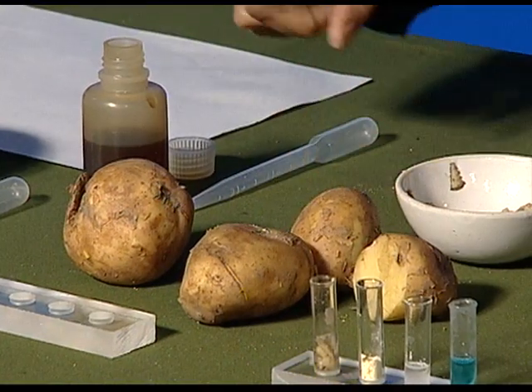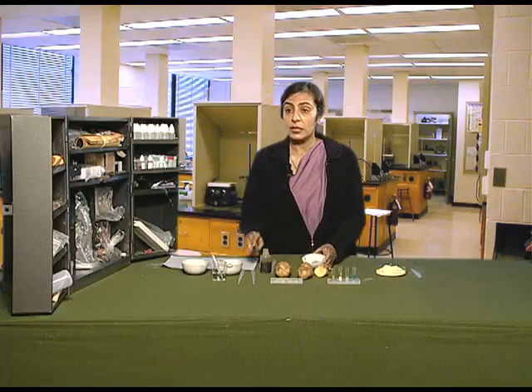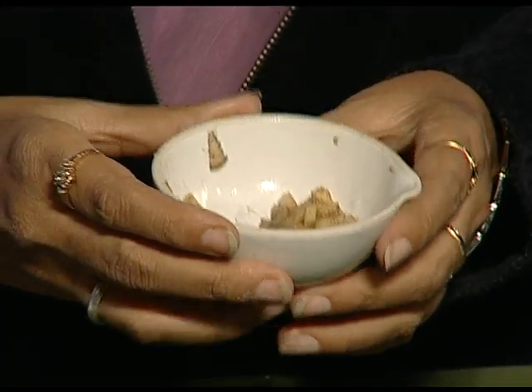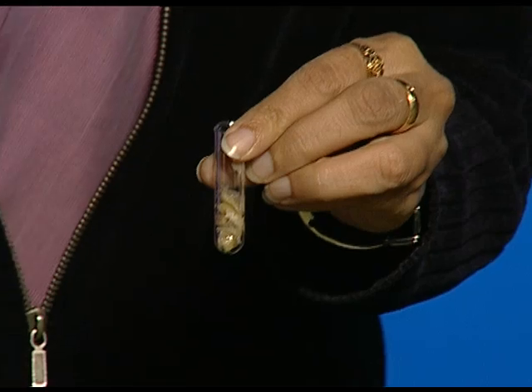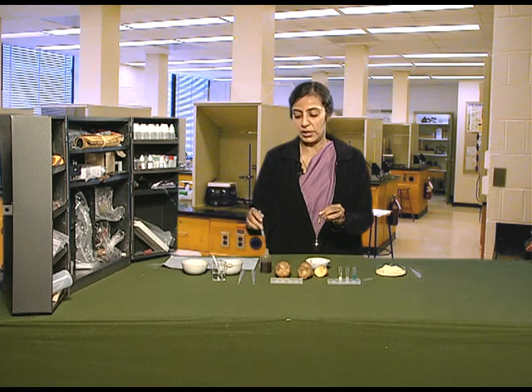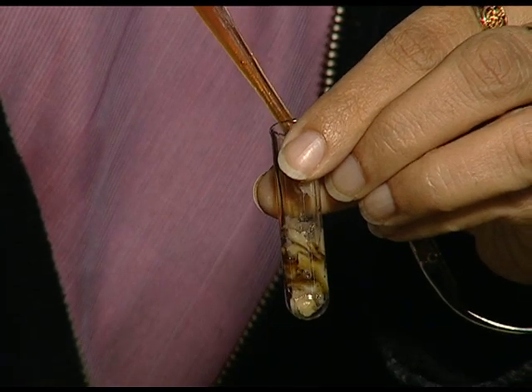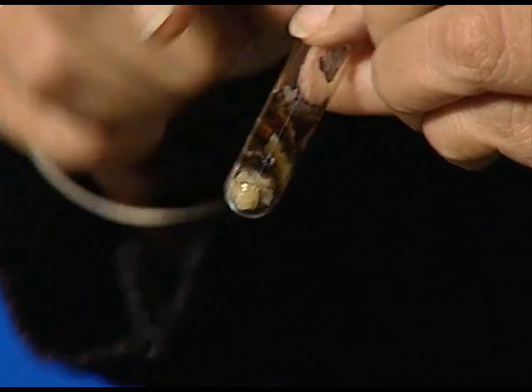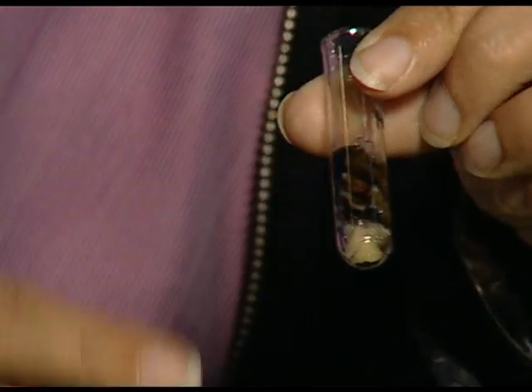First, we take starch testing. To test the presence of starch, we need potato, iodine, and a dropper. We crush the potatoes, then add them in a test tube. We take a dropper and slowly add a few drops of iodine to the crushed potato in the test tube. We observe the color changes, which shows starch is present in the potato.